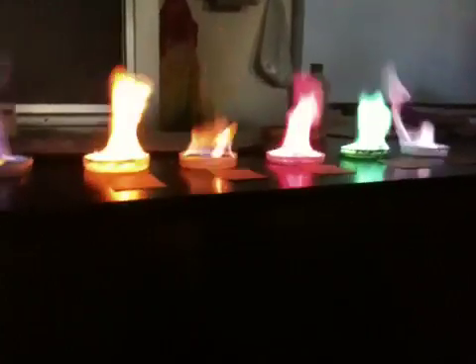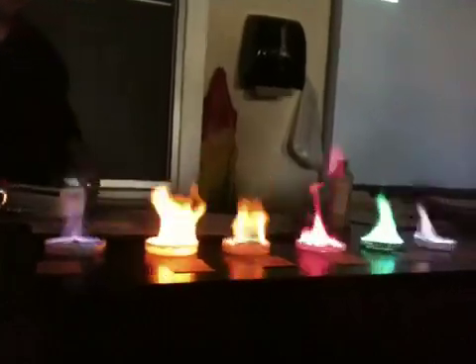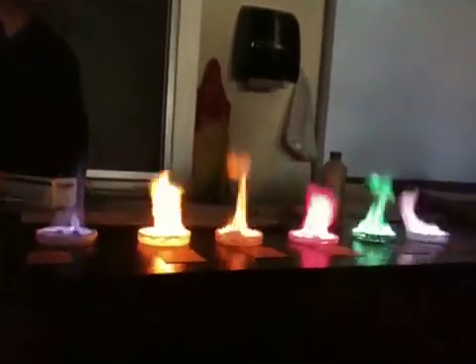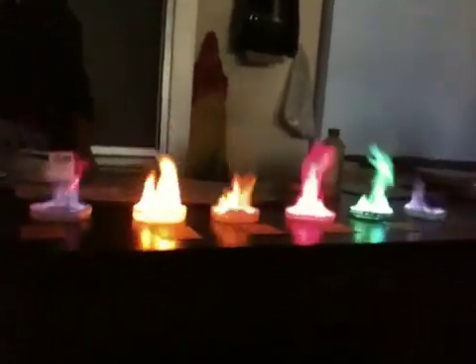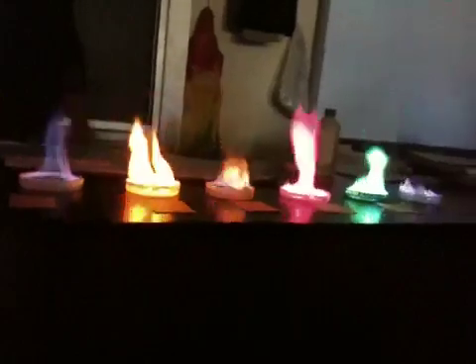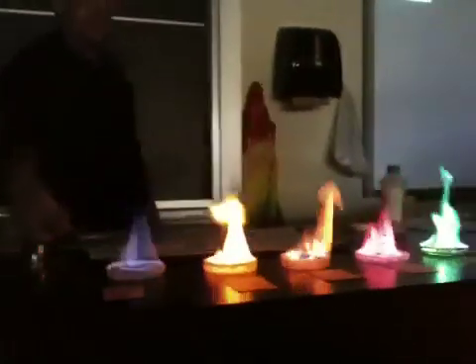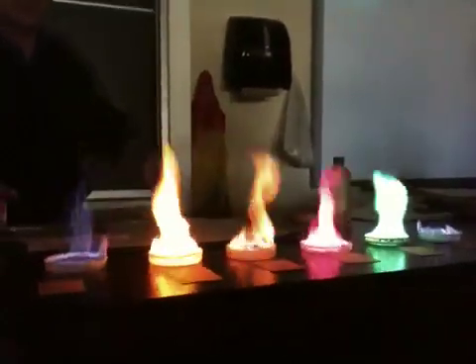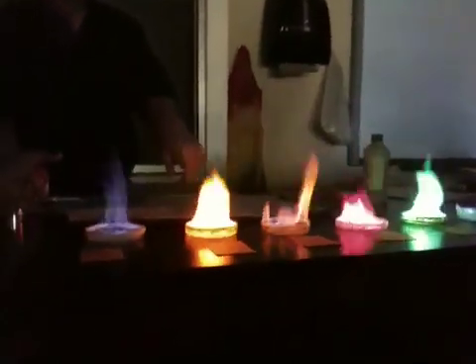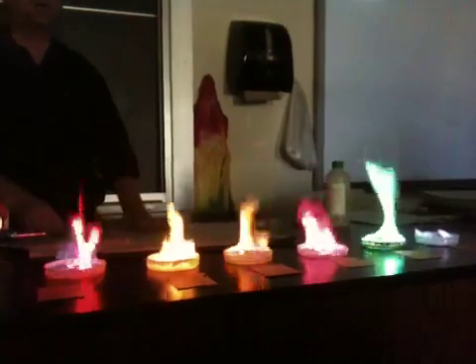Now remember, why are these colors being emitted? Why do we see these colors? They're letting off photons. The photons — and how much energy is associated with those photons? The energy associated is going to be equal to whatever the color of light is. This is going to be what color light? It's supposed to be orange. The strontium is not showing up very well. The sodium — when those photons are being emitted, when those electrons get excited, they jump up. When they fall back to what state?